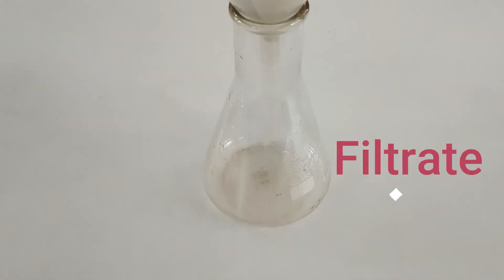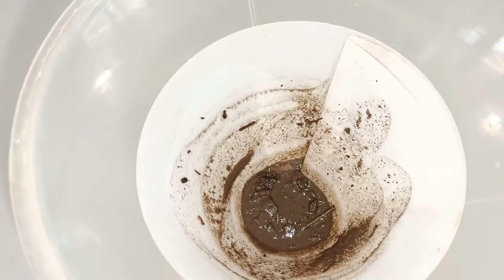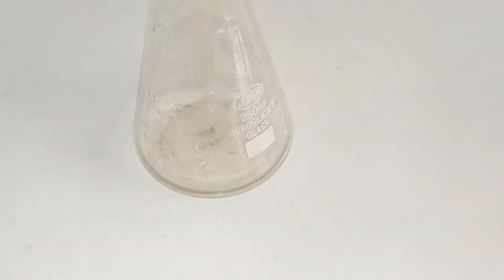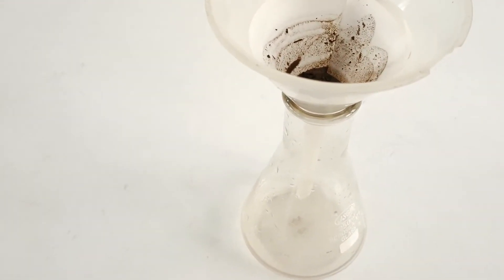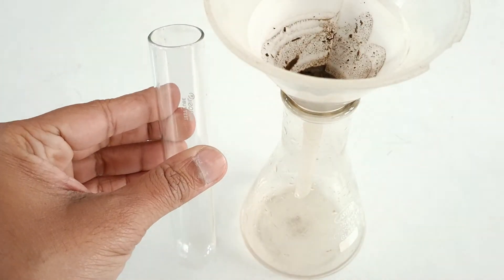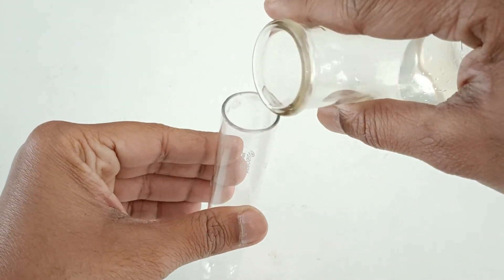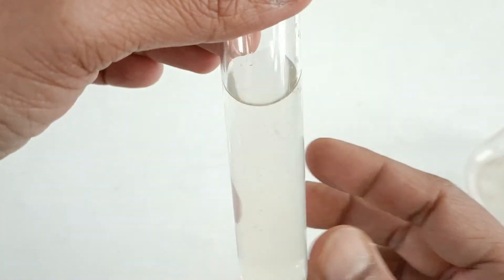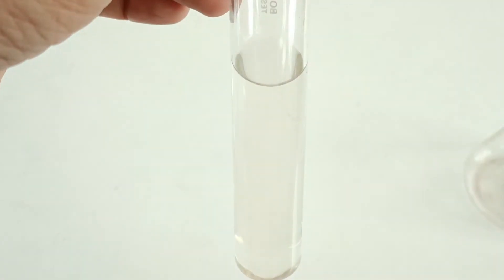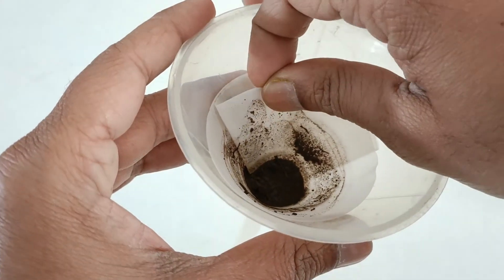The clear liquid collected below in the conical flask is known as filtrate. The insoluble solid that remains on the filter paper is known as the residue.